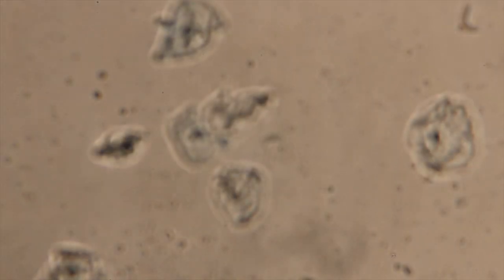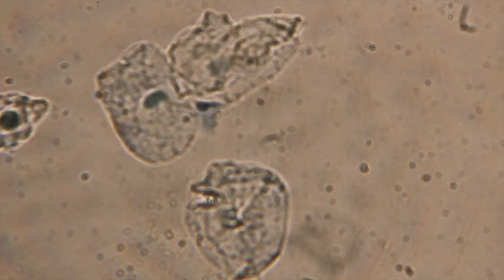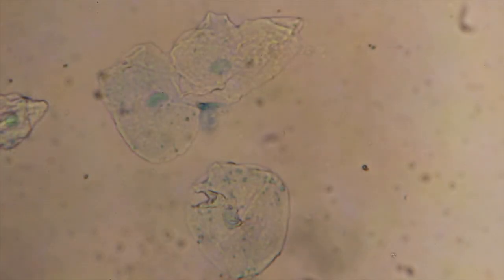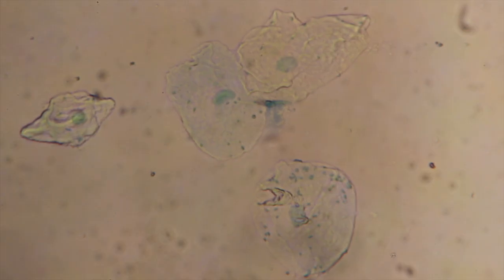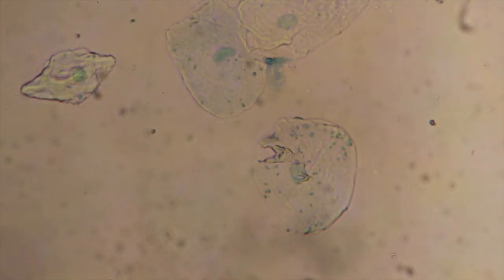Then I'm going to go up here under the 25x. It's a little bit better. Finally, then we'll move up to the 40x. Increase the light to increase the resolution and focus so we can see these cheek cells under the 40x objective. Actually, we can see them really clearly here. So there's a nice cheek cell here. The little blue dots are actually bacteria on the cheek cell. We're going to look at those in more detail if I can move this gently. And we can see that cell right there.